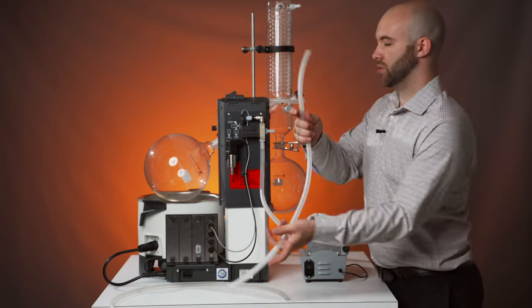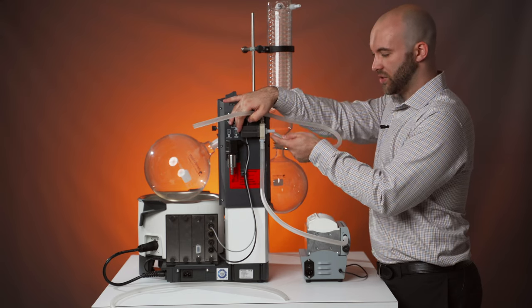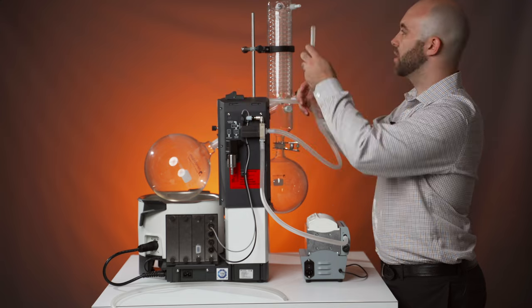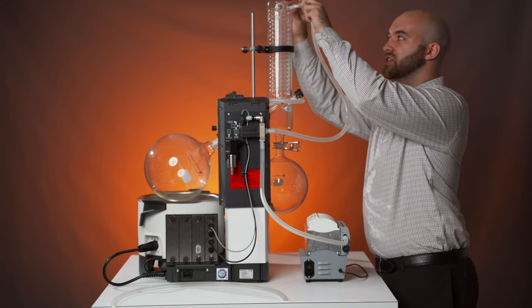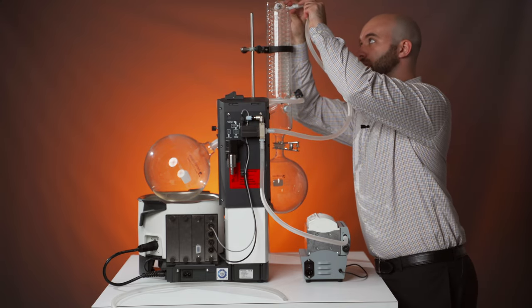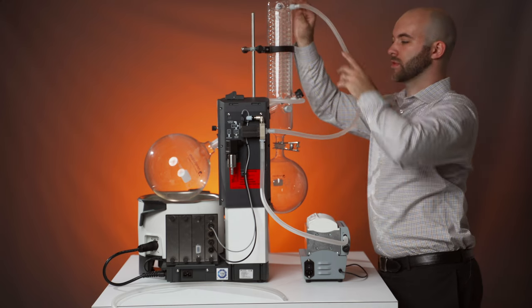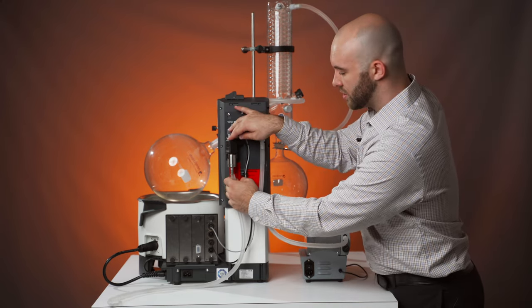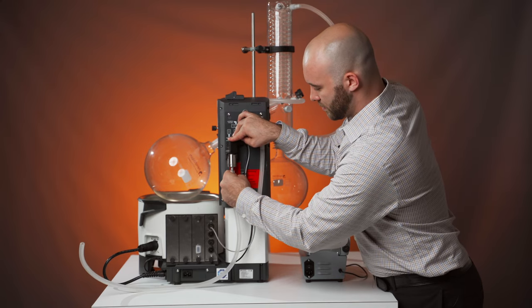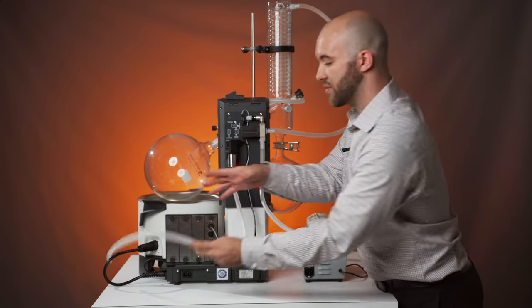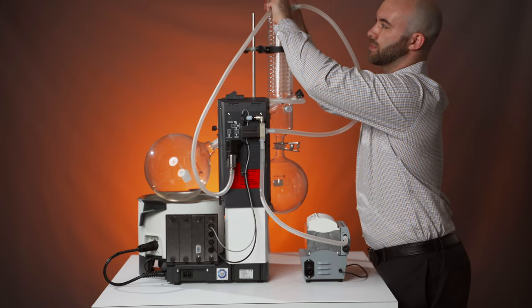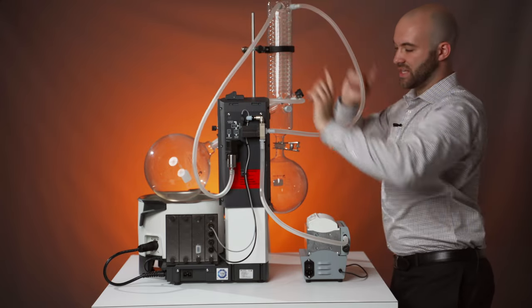Second, you will connect the other side of the unit. This is your aeration valve, three two-way valve, to one of the two upper slots on your condenser. And last, you'll connect your vacuum sensor to the other available slot on your condenser. That's the vacuum line.